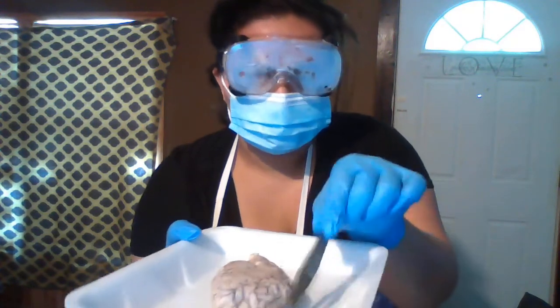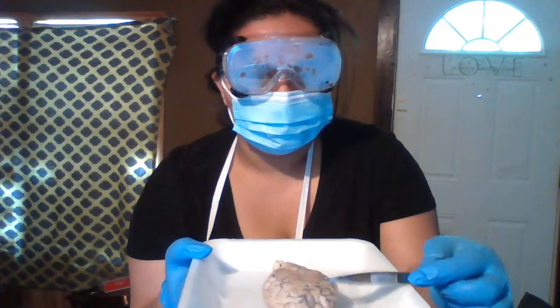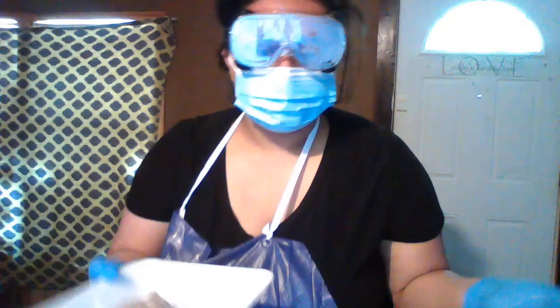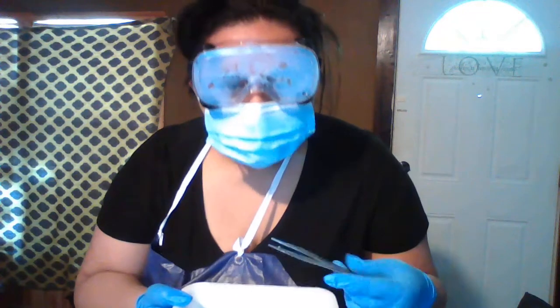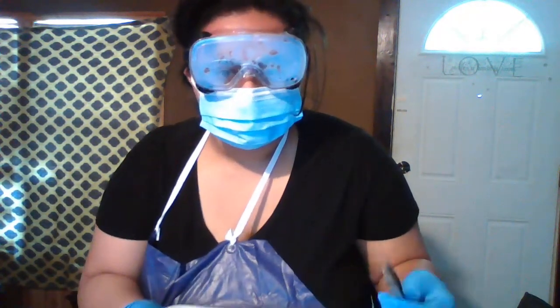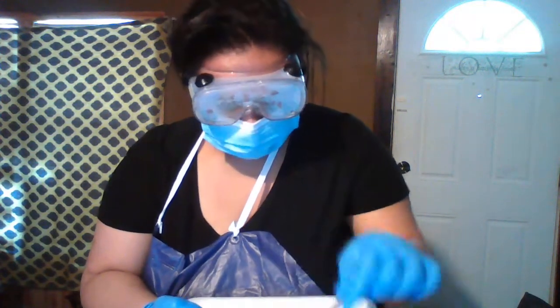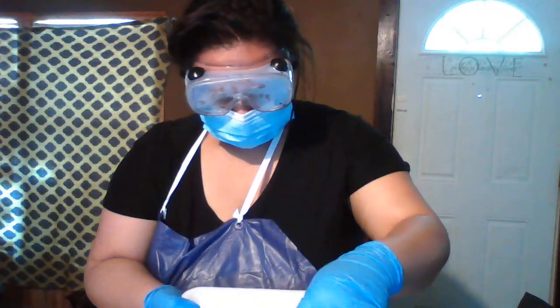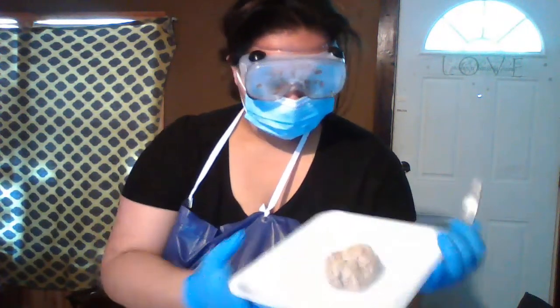The temporal lobe is here on the side, and it looks like a slight bulge. Okay, and it says that it's superior to the hippocampal gyrus. I hope I said that right. Okay, it says we're now going to turn the brain over to examine its inferior aspect. Okay. Switch over.